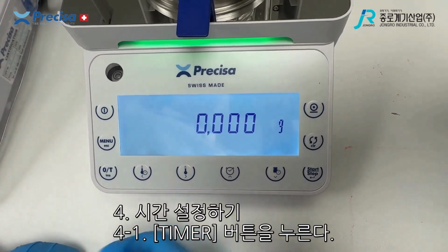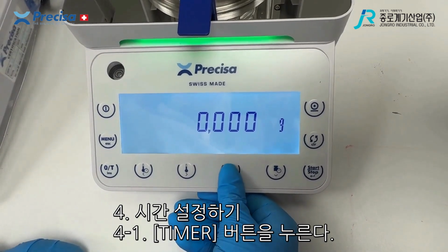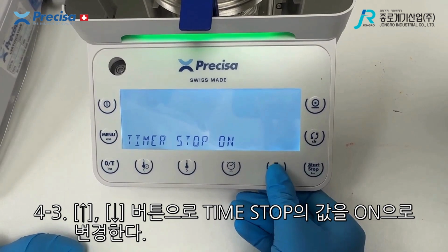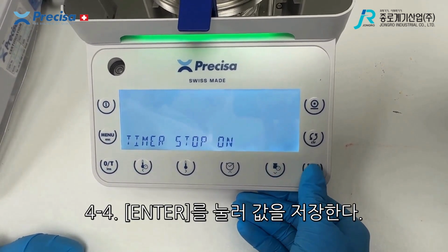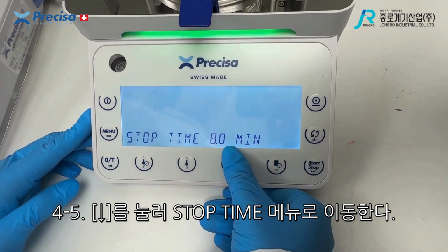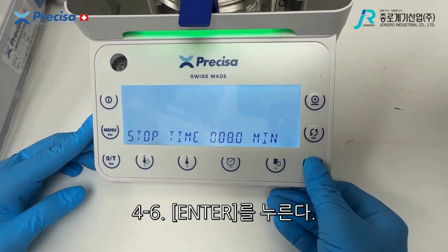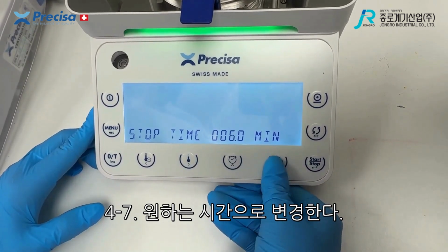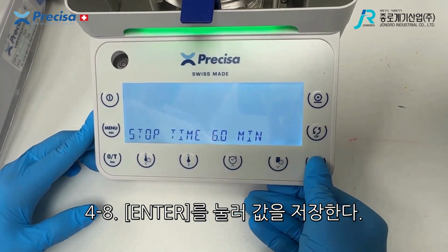In order to turn on the timer stop, you press this button here, press start, and then you can scroll down to turn it on, press start to lock it in. Scroll down again, and now you're able to change the stop time. Press enter, and then you can scroll over and adjust the time accordingly. Once you're happy, press start to lock it in.